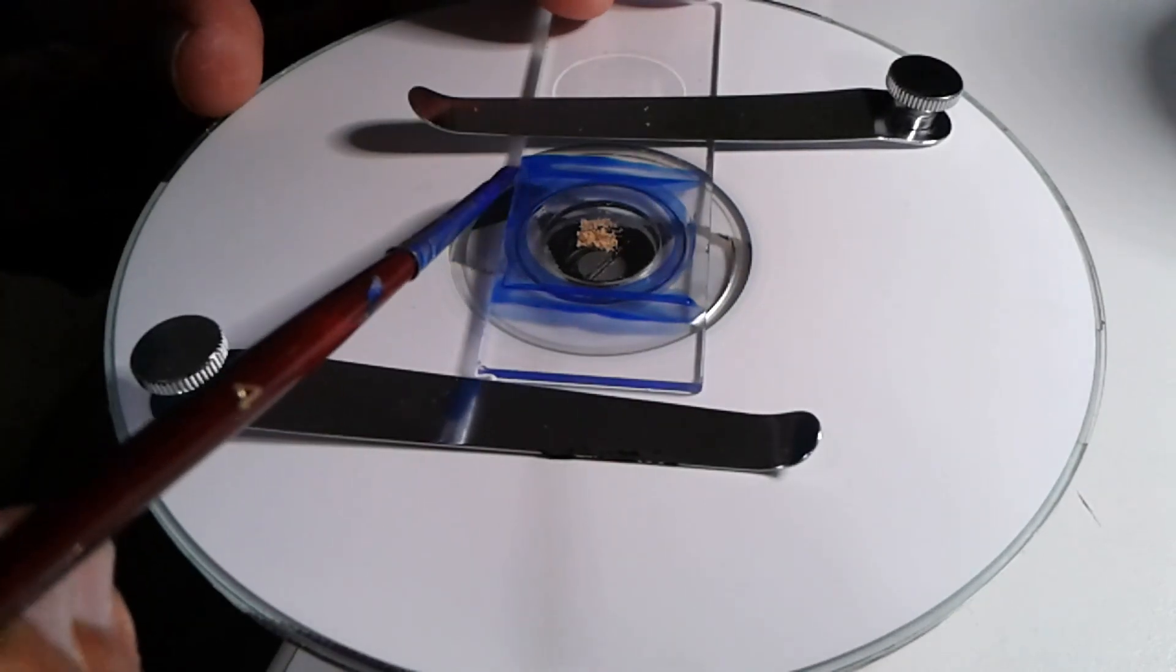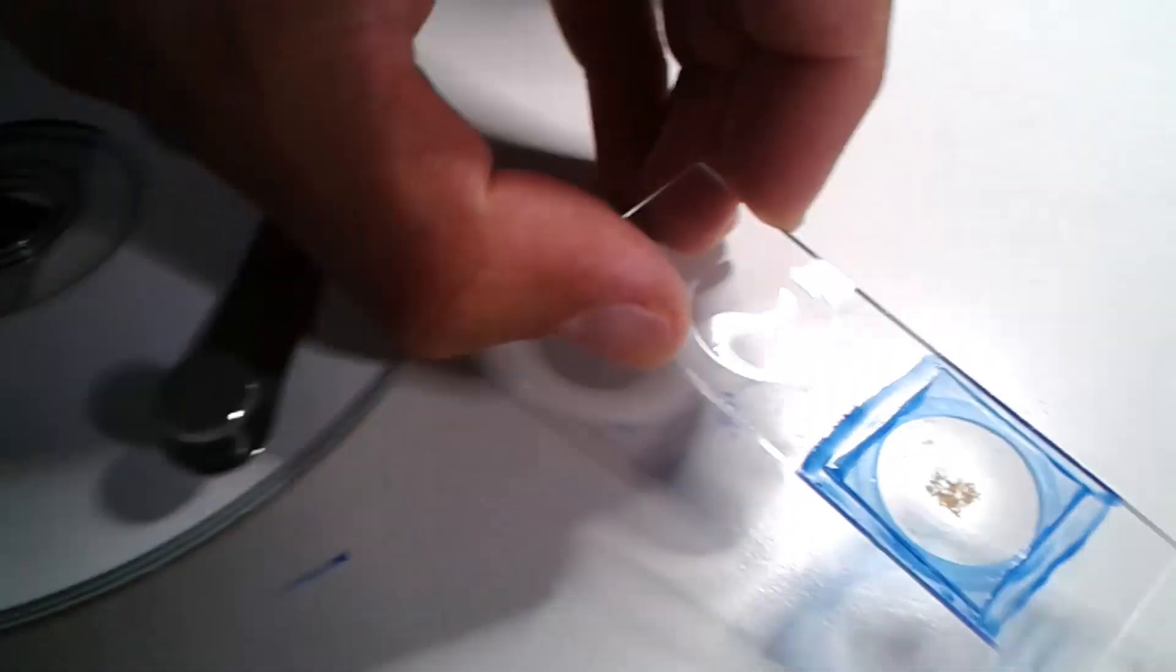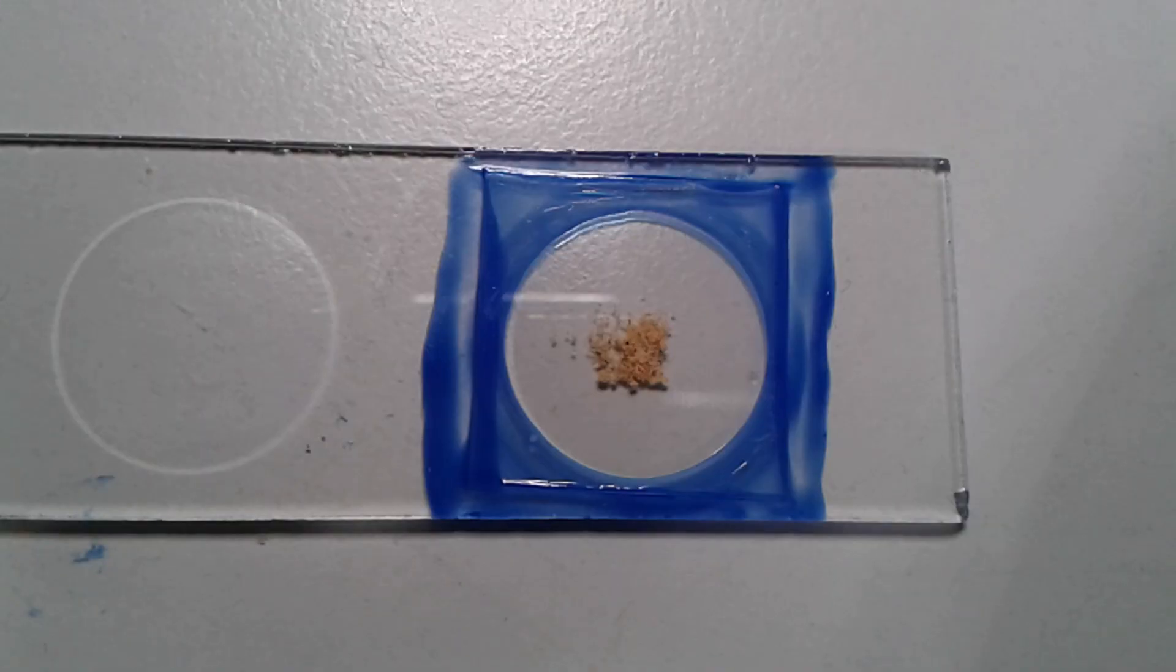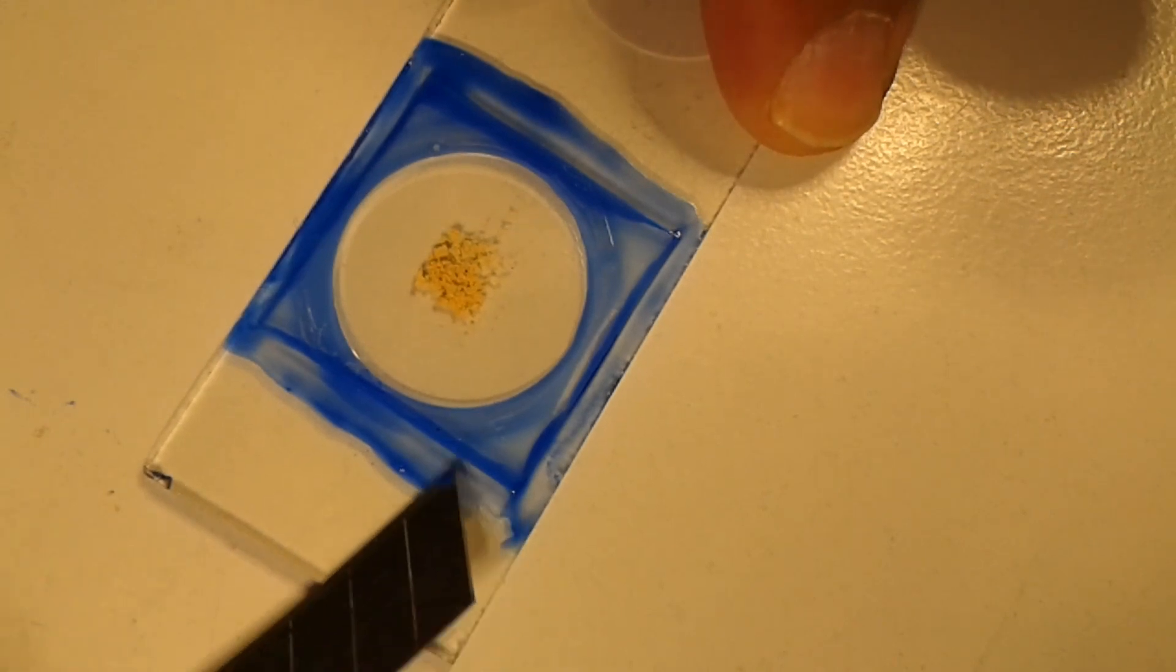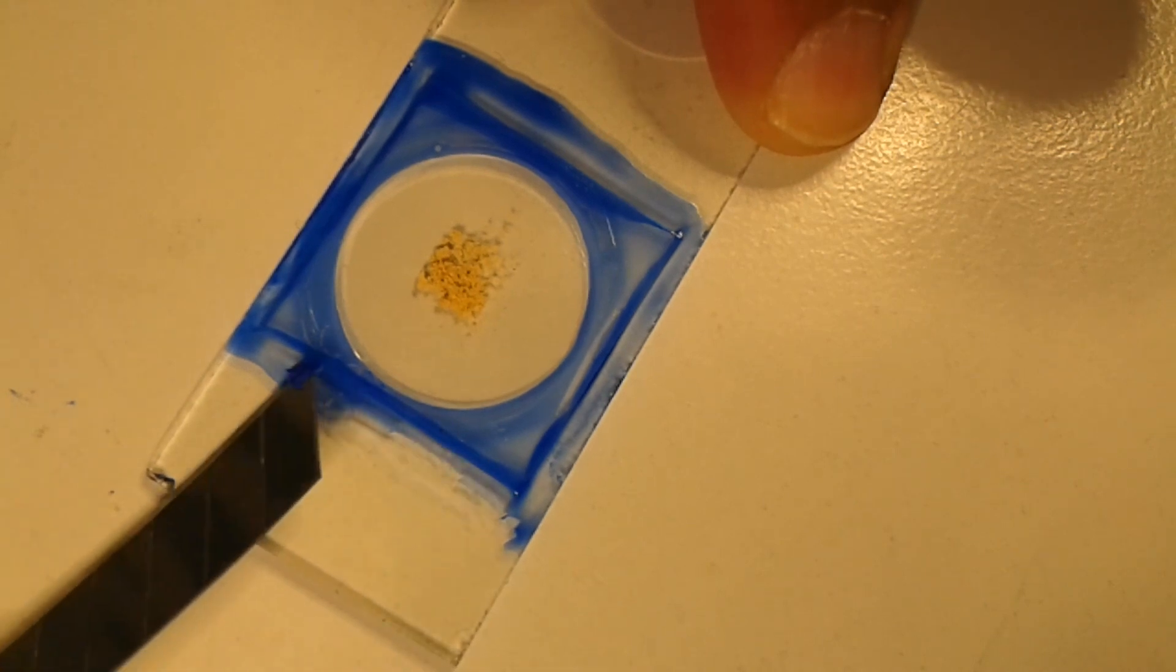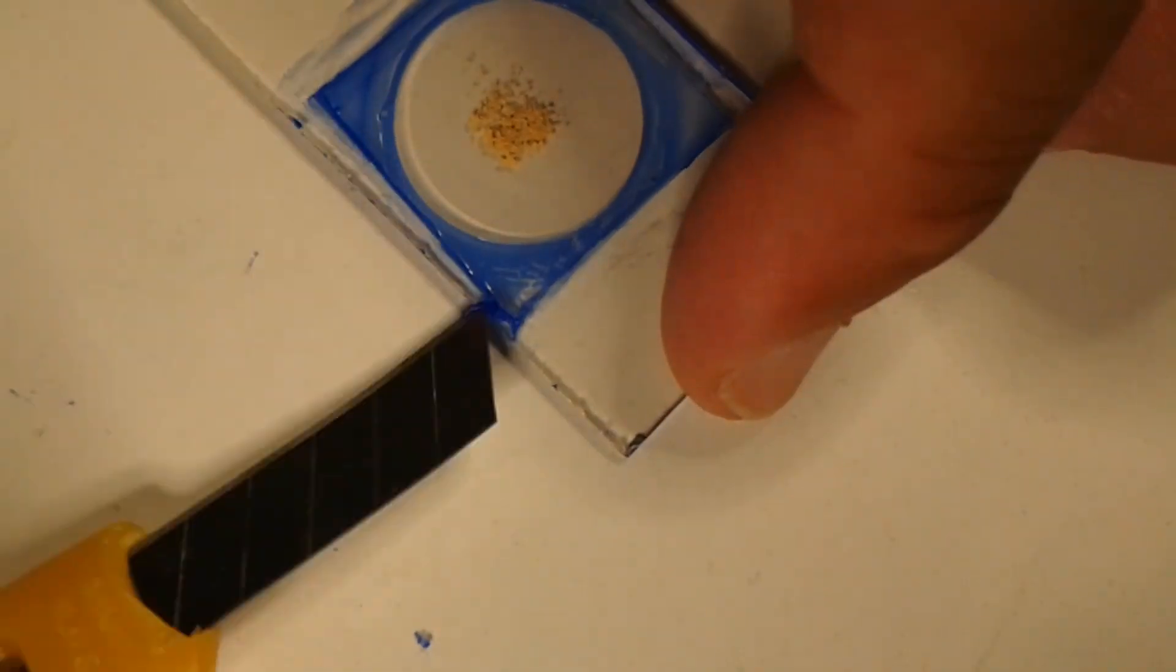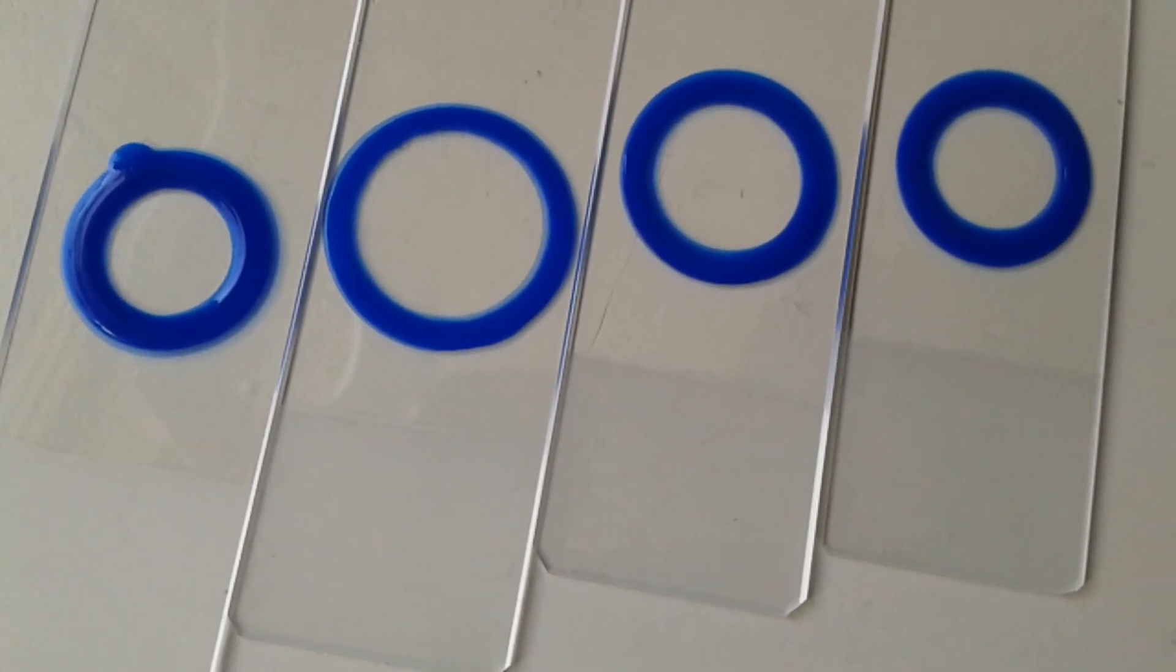One disadvantage of using a concave slide is that they're a little bit expensive, but I wanted to give it a try. Not very nice, I have to admit, but it did work. For cosmetic reasons, I decided to scratch off the excess nail polish with a sharp knife to make it look nicer.